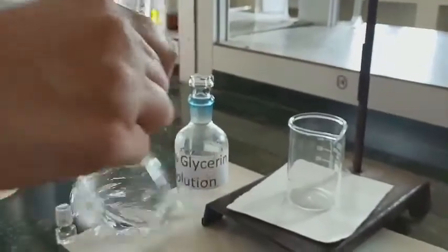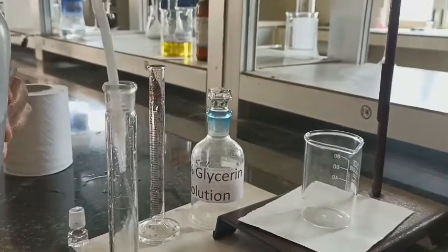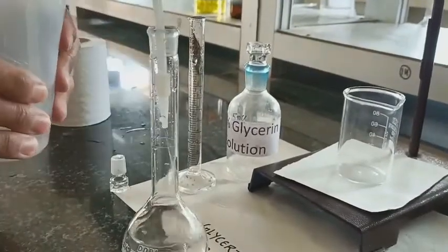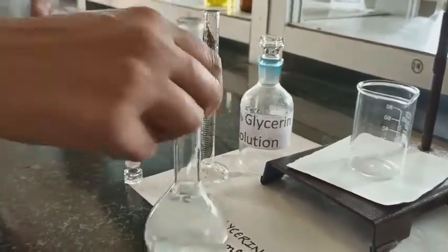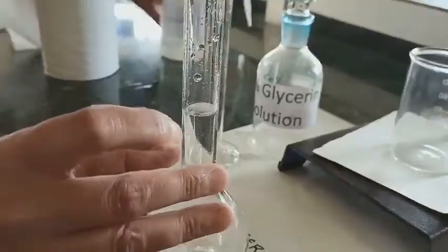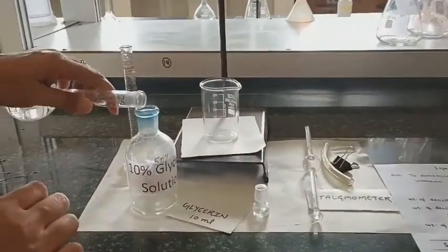Now I shake it well and make it up to 100 ml with distilled water. This is how you prepare a volume-by-volume percent solution. If we need 10%, we add 10 ml; if we require 20%, we add 20 ml of solute. Again, we read the lower meniscus. We will then transfer this into the reagent bottle.